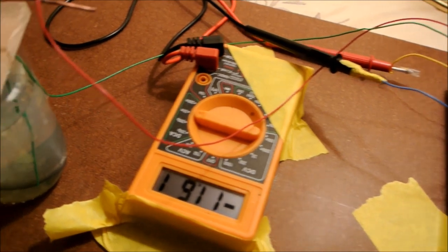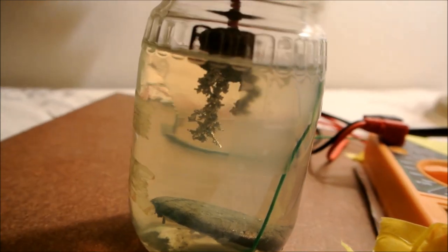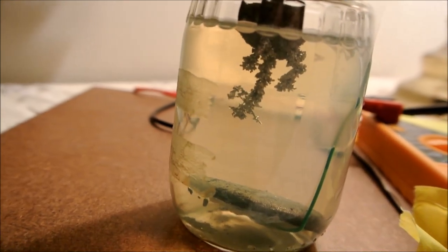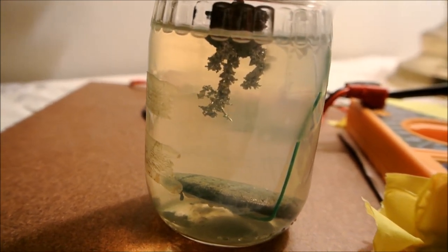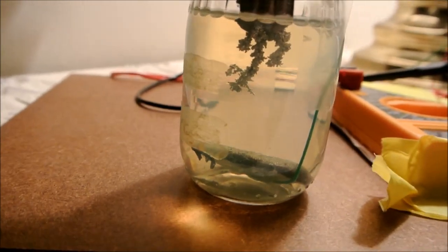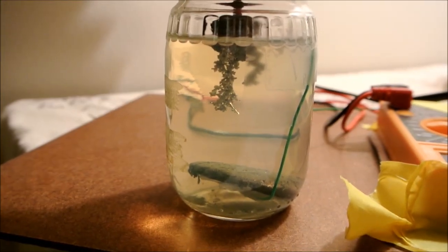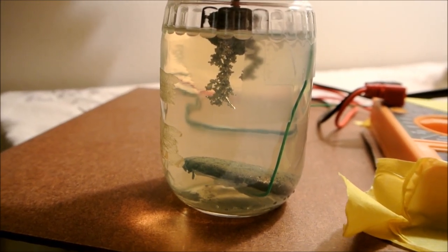Here it is, not even a week later. And as you can see, the tin has made some very nice crystals. I've been stirring the solution about twice daily just by swirling the jar around, and it looks like it's clouded up a little bit, so perhaps some of the tin chloride has started precipitating.